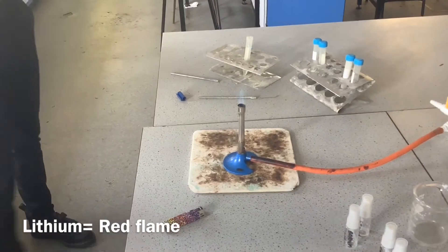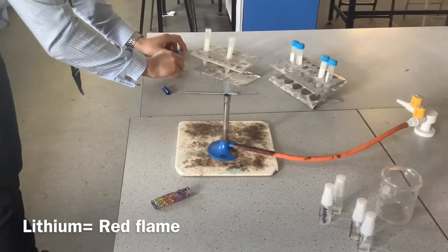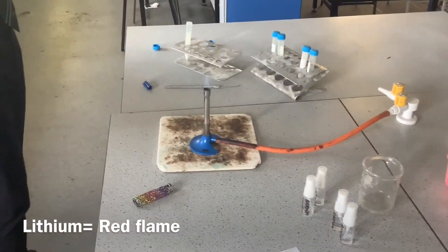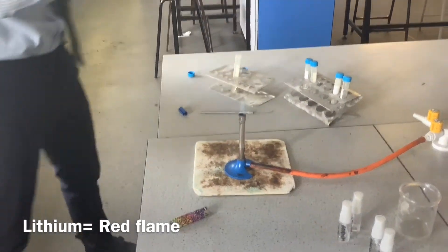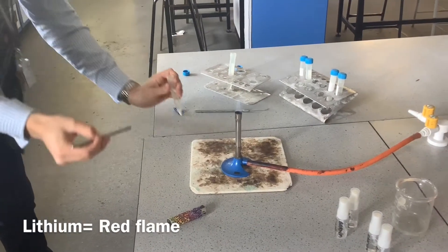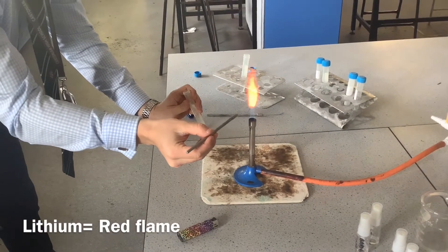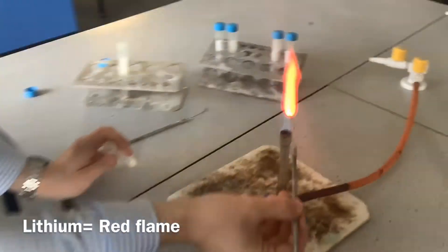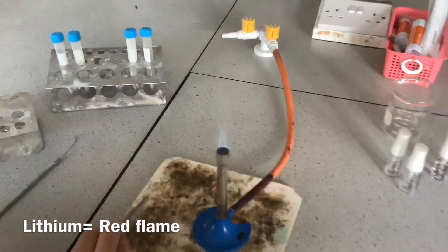Now we'll look at lithium. Lithium — we're expecting red. Any key terminology with this, or is just red fine? Some people say crimson. You can see a really good colour change — if you come around this side we can see it really well on this side of the flame. So we've got lithium — crimson.